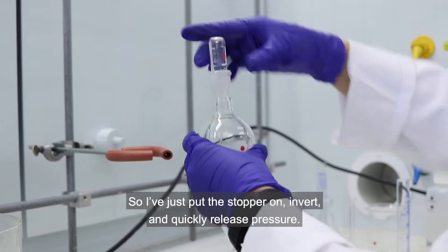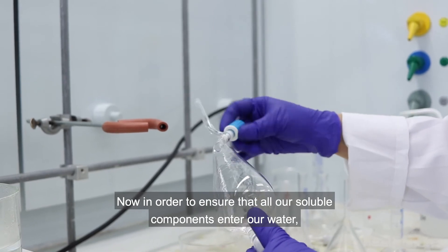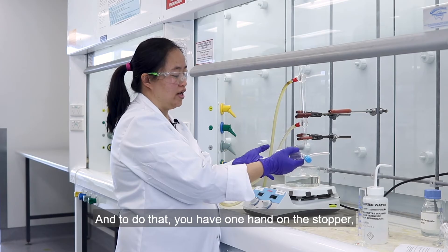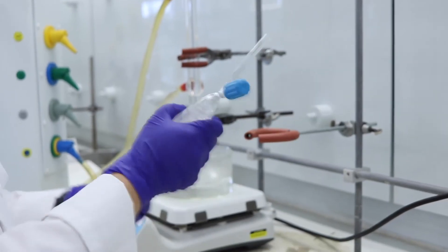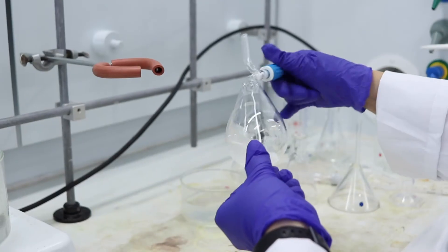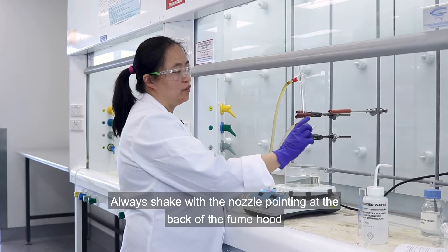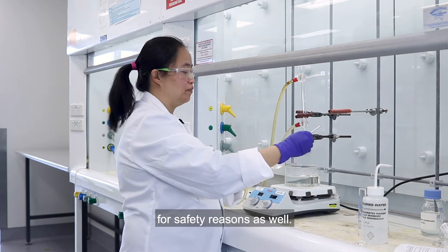I've just put the stopper on, invert, and quickly release pressure. In order to ensure that all our soluble components enter our water we have to shake it — one hand on the stopper, the other on the separating funnel, and shake. Release pressure frequently in case there's some gas build up. Shake, release pressure, and do that three or four times. Always shake with the nozzle pointing to the back of the fume hood for safety reasons.